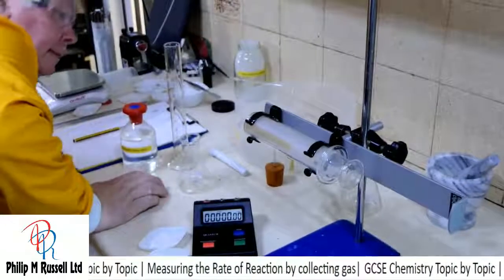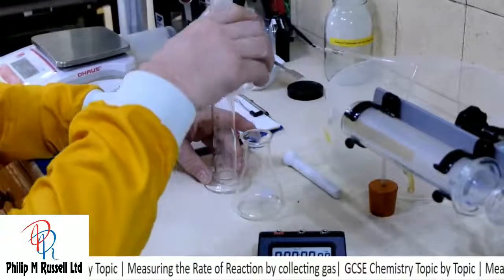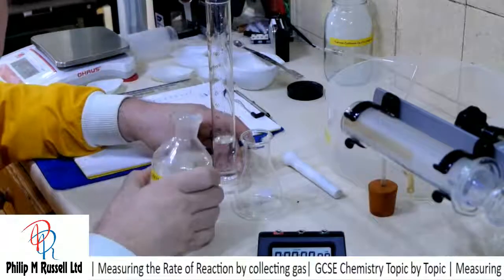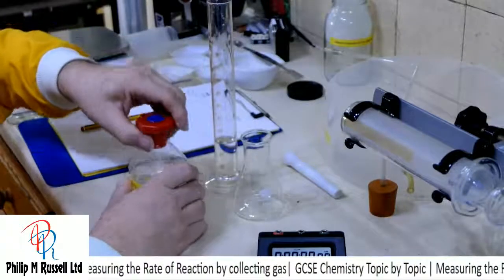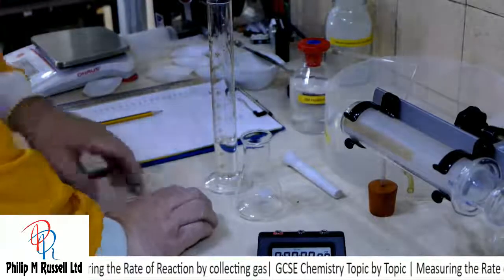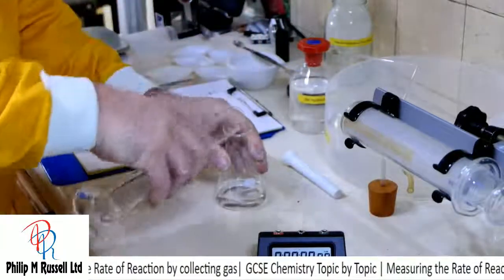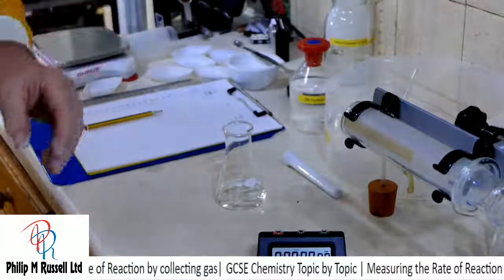Right, I will get down so I can see this, and I've got 30 mils. So 30 mils of, in this case, 2 molar hydrochloric acid. It's a rather large measuring cylinder, but it works for what I want.